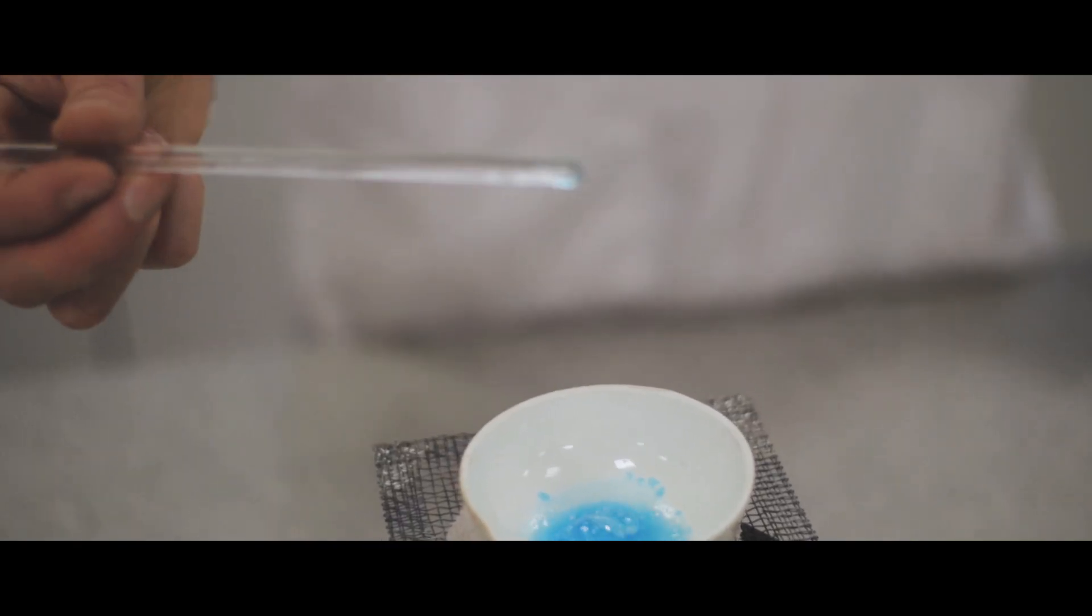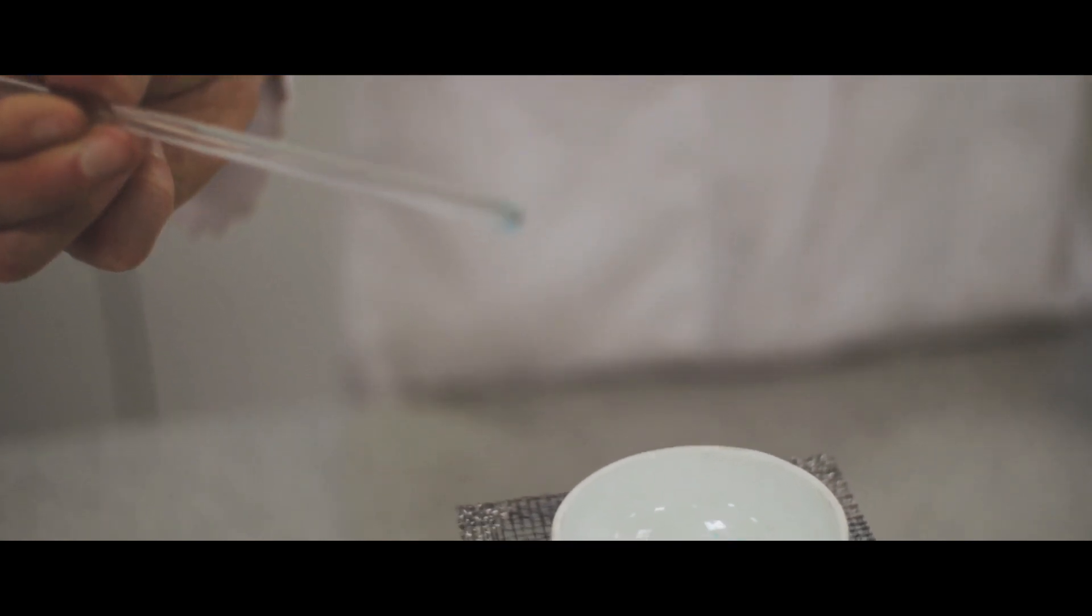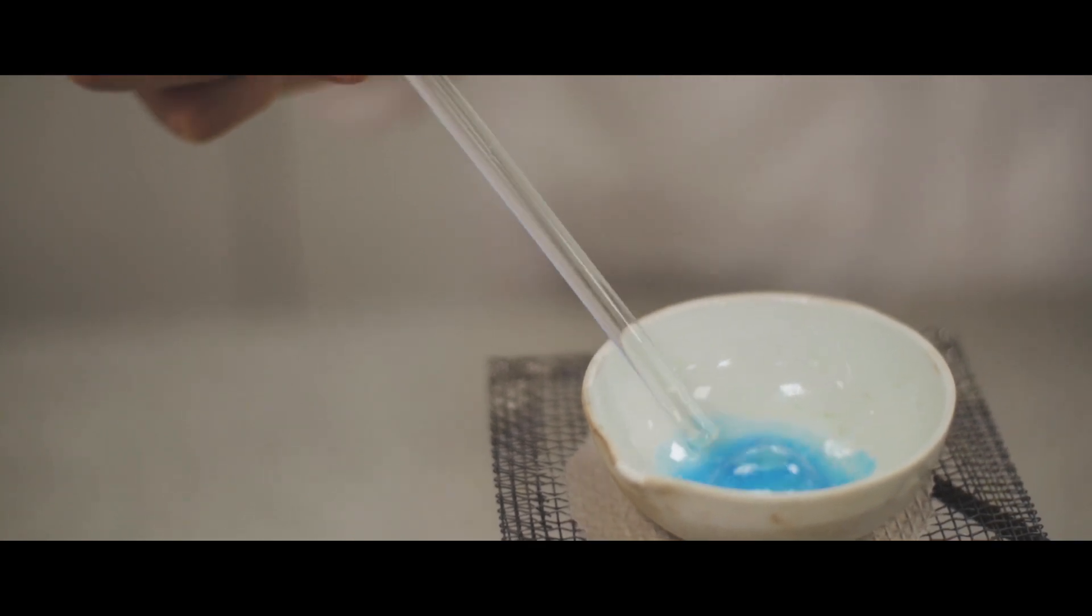So we can use a glass rod by taking it and then dipping it into the solution and leaving to see if the crystals start to form. So it's not quite ready yet.